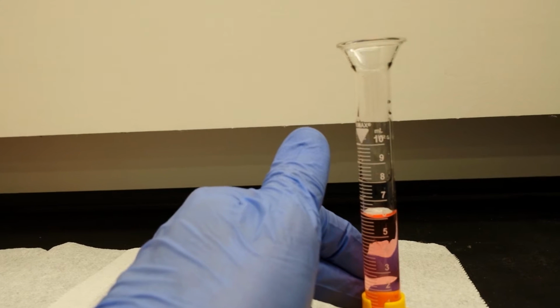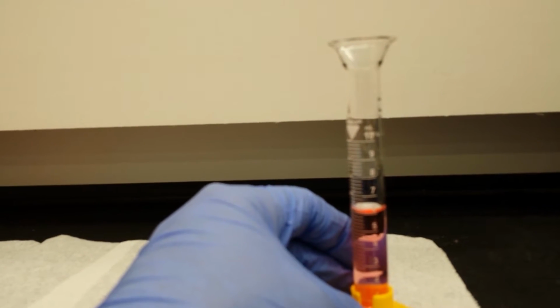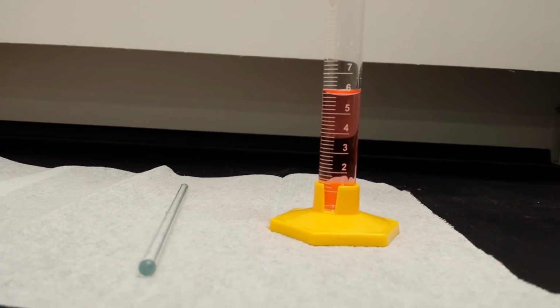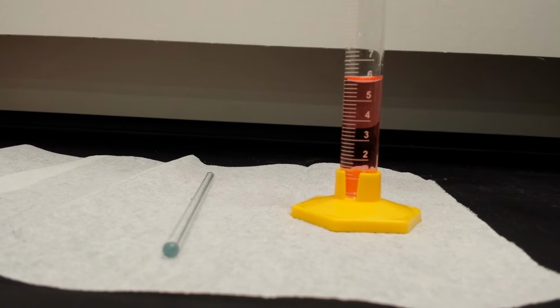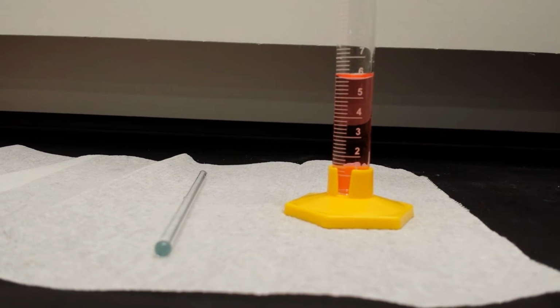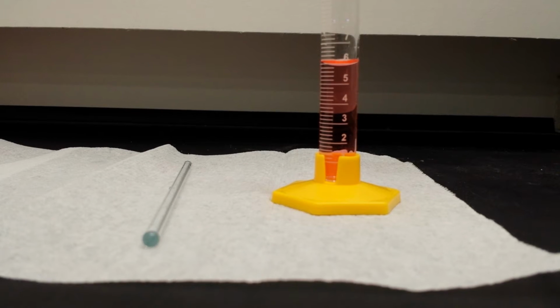Our sig fig rules are somewhat crude. That's just because it saves us from having to deal with a whole lot of statistics instead. Statistics are the real way that we do sig figs later on. Now, if we get level, we'd say, okay, that looks to be probably about 5.8, I'd call that, maybe 5.9. And that's as much quality as we're going to get from this, which still seems like it's not too shabby.